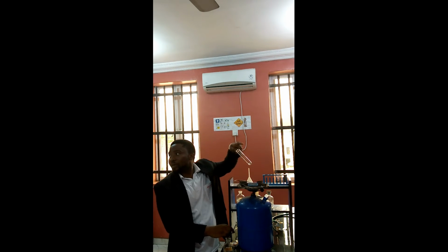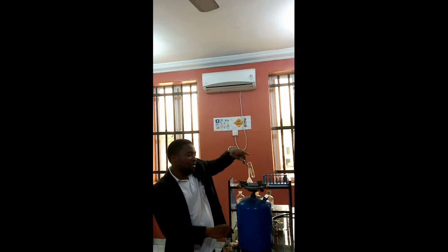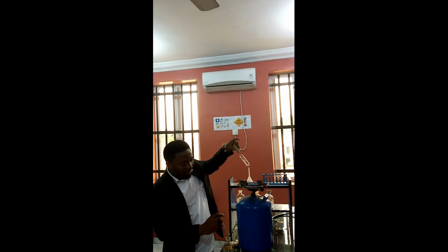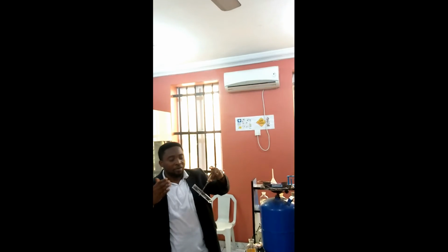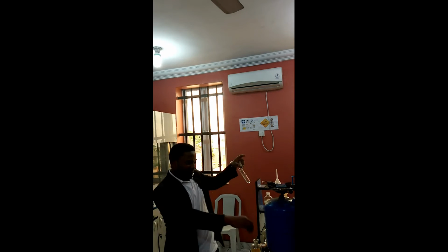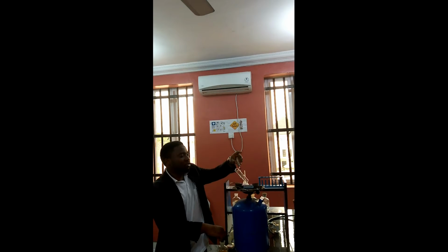I say that you dip a stirring rod into dilute HCl and bring it close to the gas that is being given off from the boiling tube. So there's a gas that's coming out, and that gas I need to bring close to my nose, sweep it. Remember, you don't put your nose inside the boiling tube to perceive, you just sweep close to your nose. So there is a gas with a choking smell coming out from the boiling tube.